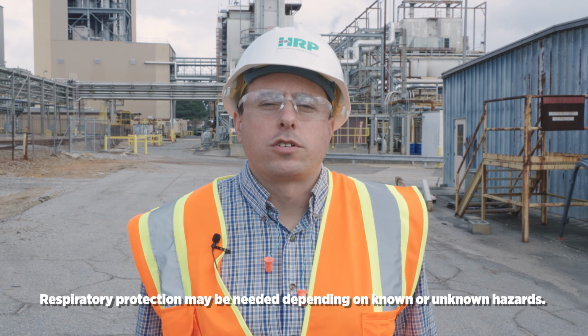Purchase order number, if you've issued a purchase order for this, for the lab to bill. If there's a quote number, here I'm going to put not applicable. Turnaround date required, so there may be a rush on this sample. In this case, there's no rush, so I'm going to circle 5-day. This is not in accordance with any compliance monitoring.